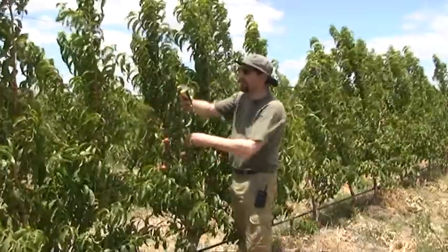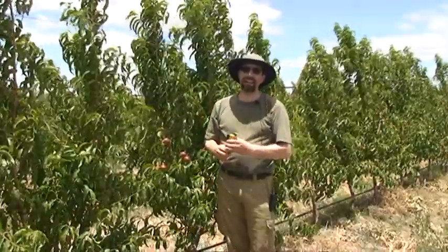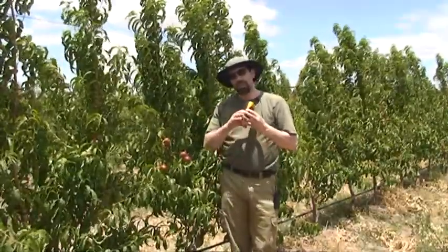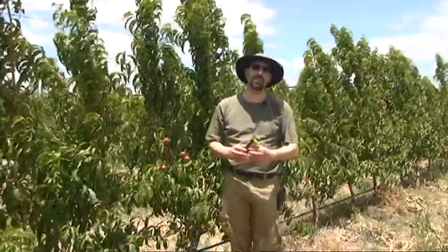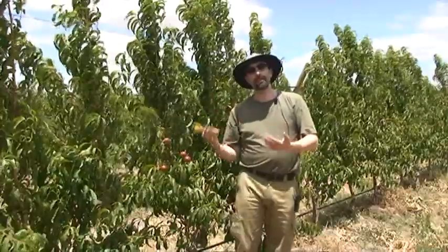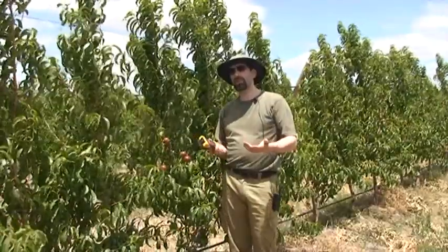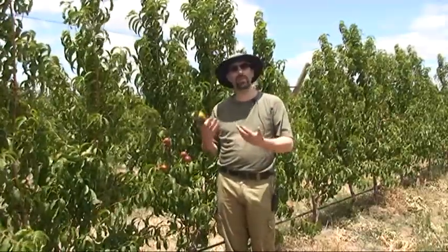To get a correct measurement we need to measure several fruit in the orchard. We should tag at least 25 fruit randomly and follow those throughout the entire season to understand fruit development. To capture the spatial and tree variability — one of the main reasons for differences in quality — we need to measure an additional 75 fruit randomly across the entire orchard, for a total of approximately 100 fruit, giving us a solid statistical number to understand average maturity across the orchard.